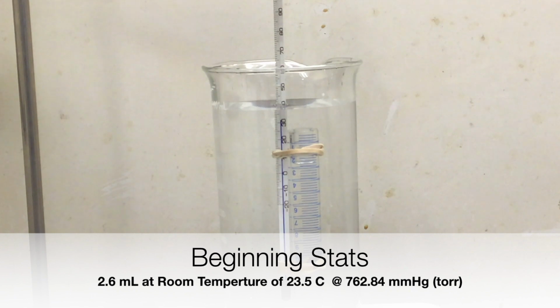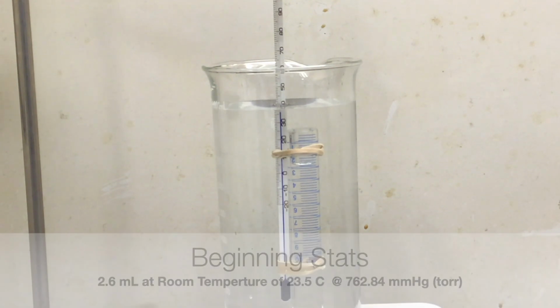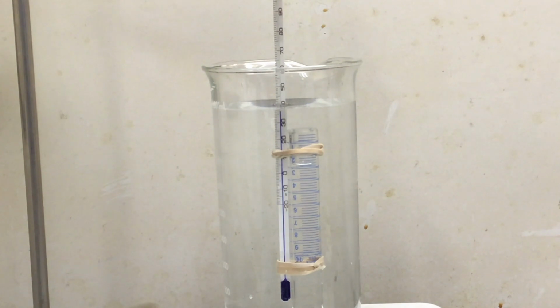We then lower our inverted and stoppered test tube into our beaker and record the volume of the bubble at the top of the graduated cylinder. Make sure there's enough water in the beaker that the test tube remains submerged throughout the entire experiment.